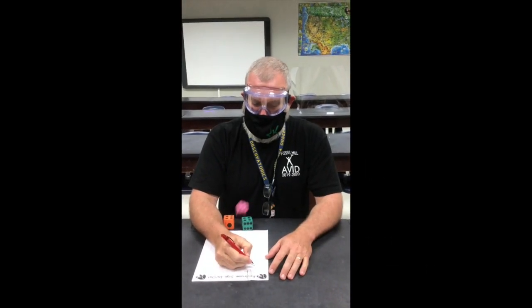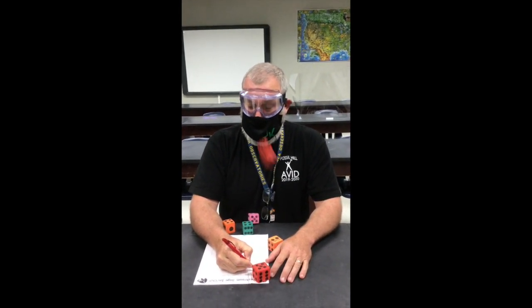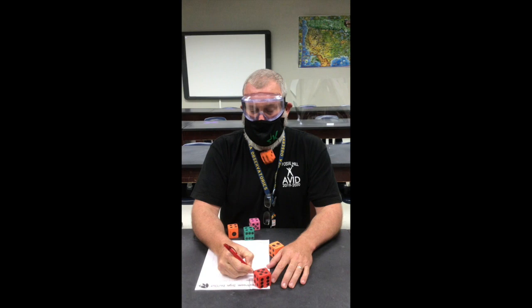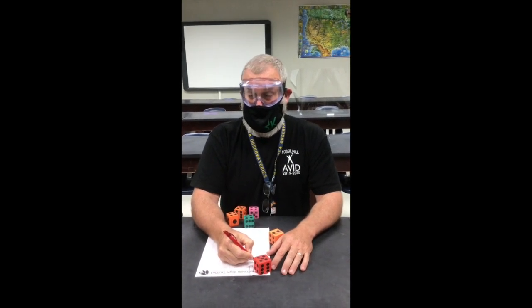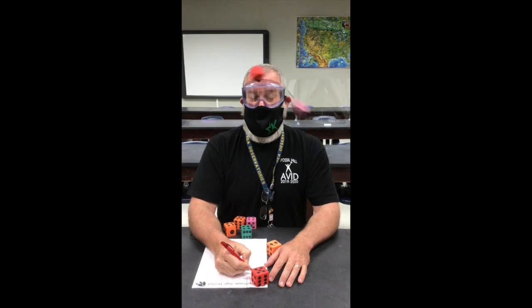Oh yeah, go for the eyes! I feel like I'm at the fair. I'm winning. Good thing I have my safety glasses on.